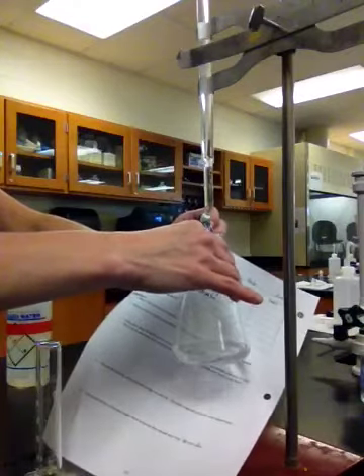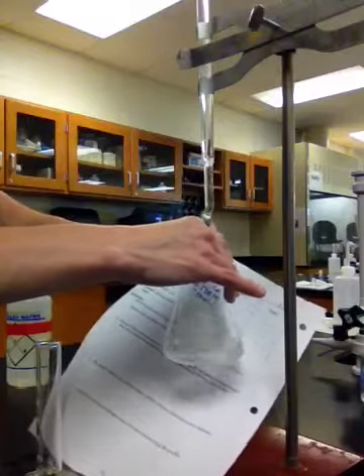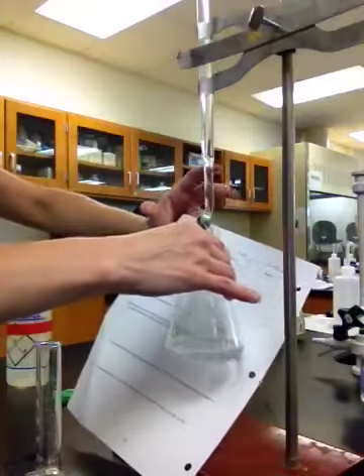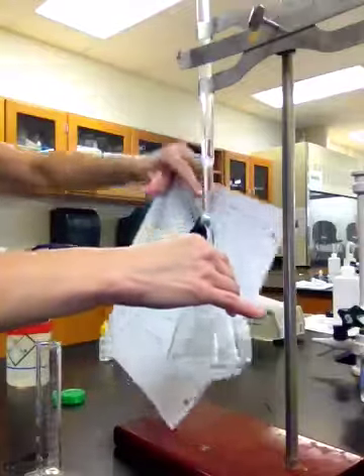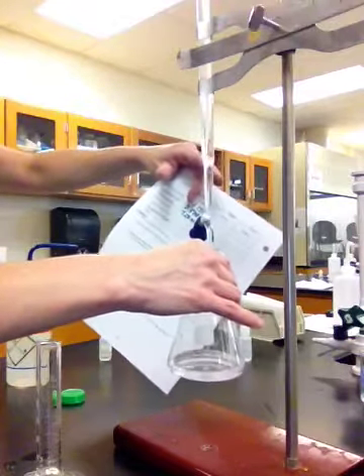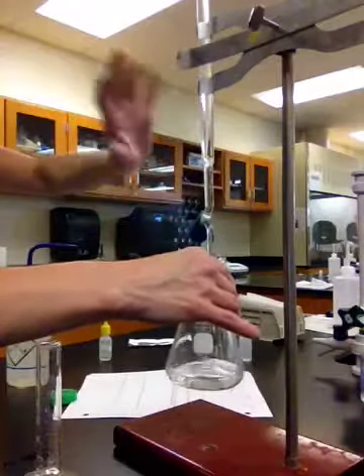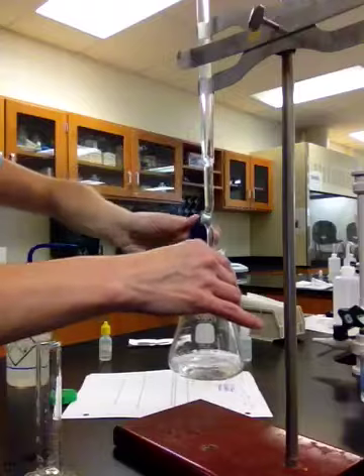That pink does not last, okay? When that pink starts to linger a little bit, I'm going to slow down, because the idea is that when that base reacts with the acid, it goes back to clear because there's plenty of acid still. But when that pink starts to linger, that means the base up here is having trouble finding acid. That means we're getting close to what's called the equivalence point.